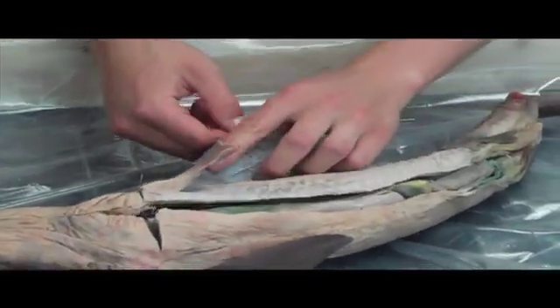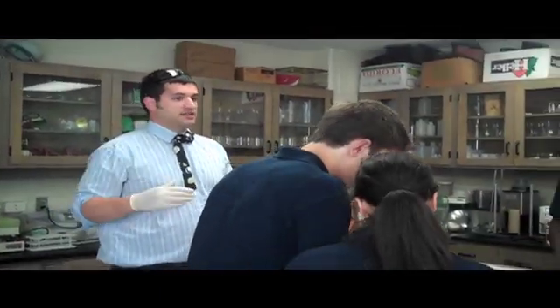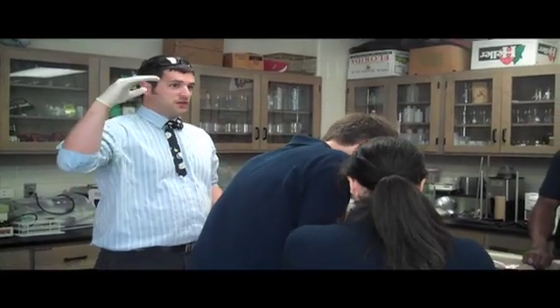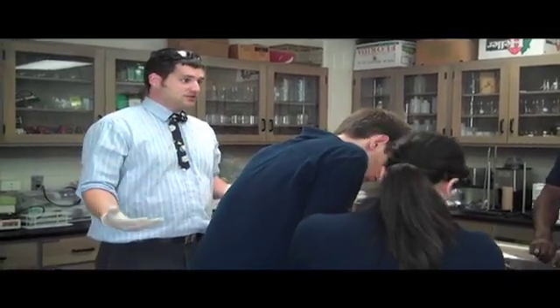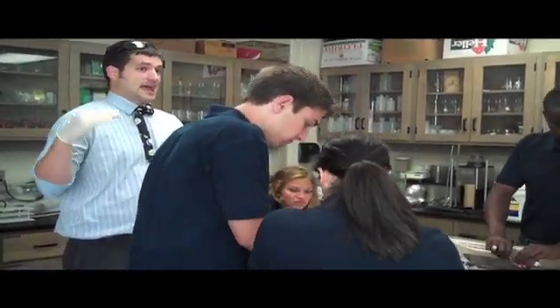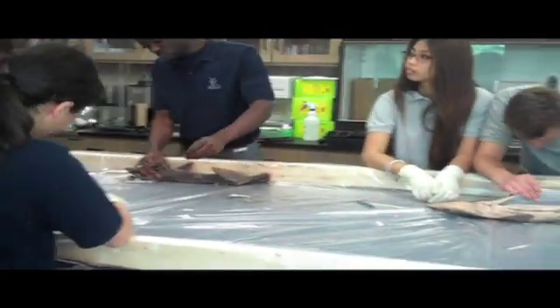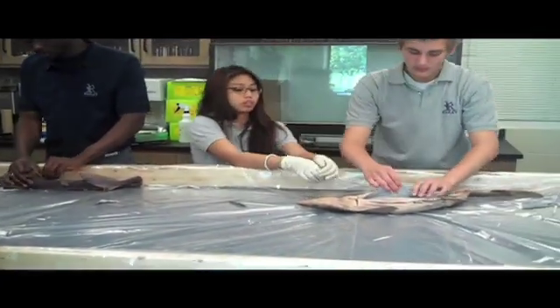So the liver's got a lot of oil in it. More evolved and modern fish have air bladders that can help control their buoyancy — sharks don't have that. As you know, oil floats on top of water; oil is less dense than water. So sharks have developed these huge livers filled with oil to add to their buoyancy. Oil isn't that much more buoyant than water, so the sharks have to have really big livers to hold all the oil to make themselves buoyant.